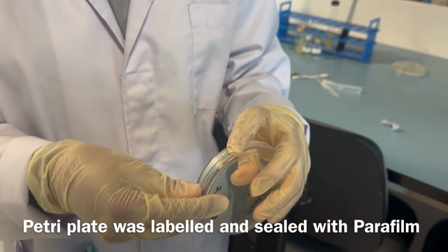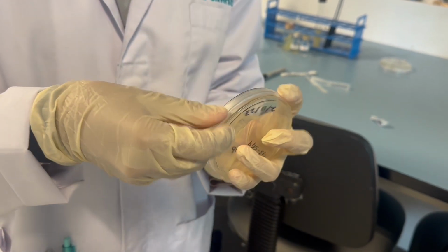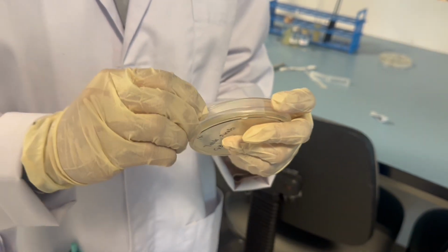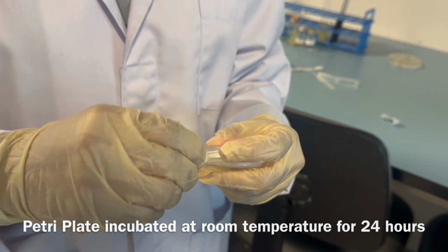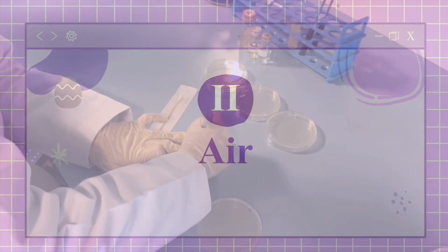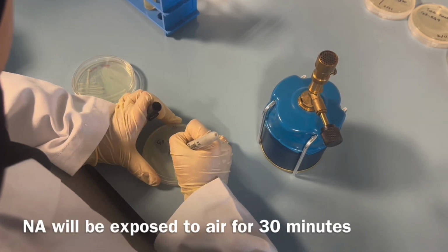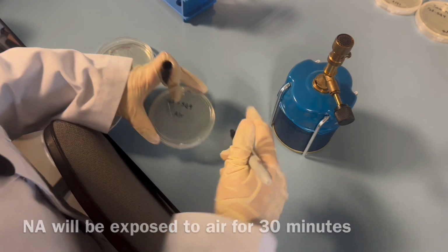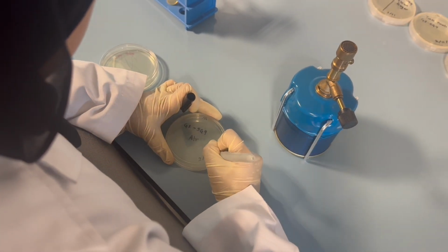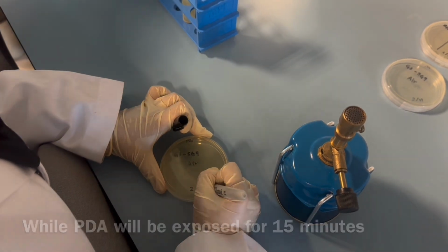The Petri plate was labeled and sealed with parafilm. The Petri plate is incubated at room temperature for 24 to 48 hours. So moving on now to air. Labeling is done to differentiate between both agar plates. NA will be exposed to air for 30 minutes and PDA will be exposed for 15 minutes.